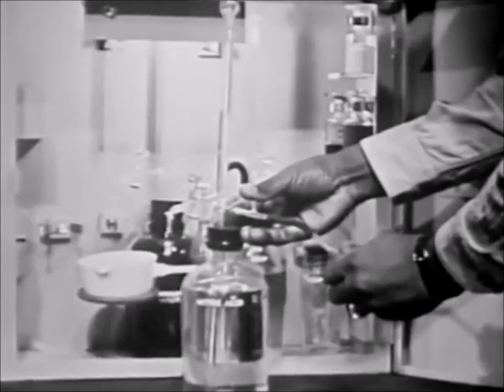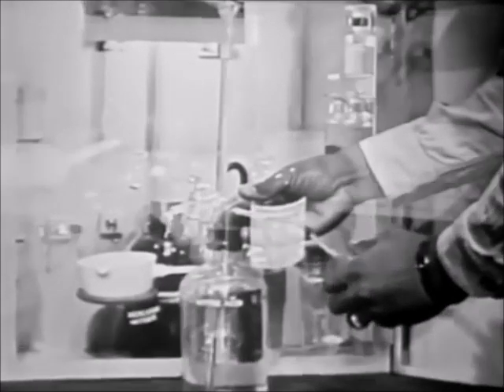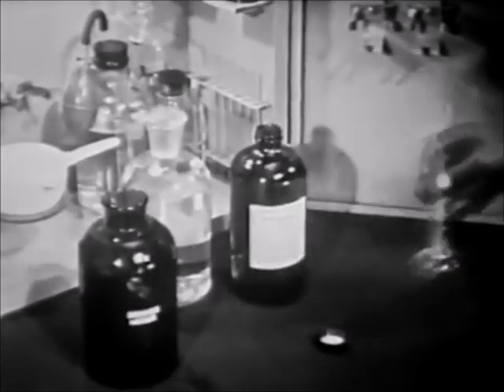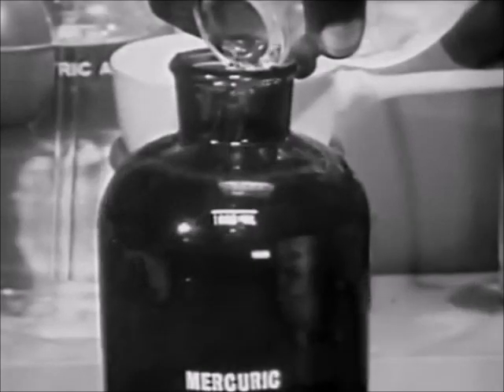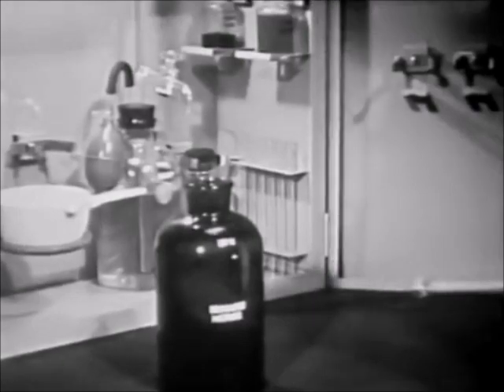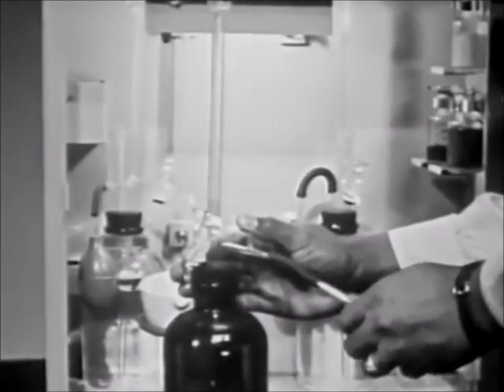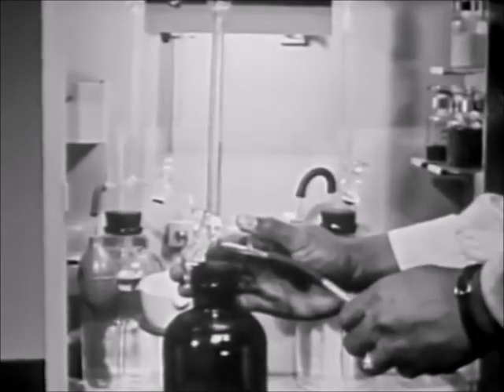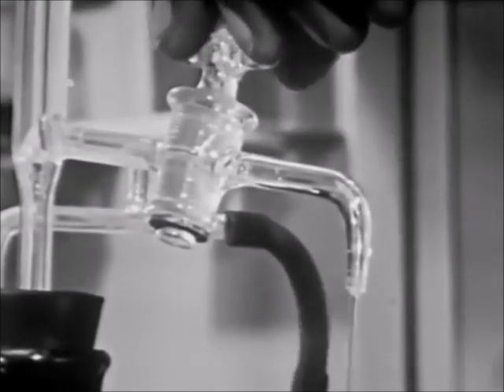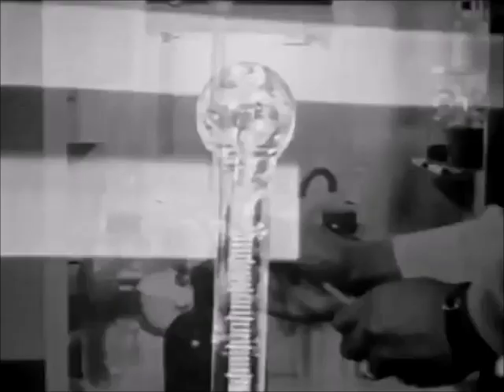Follow the same procedure to prepare the mercuric nitrate reagent. Transfer 50 milliliters of stock mercuric nitrate to the reagent bottle. Add distilled water to the mark and mix the contents. Place the burette assembly on the reagent bottle and pump up the burette. Drain a little solution to be sure the burette tip is full, then pump the burette back to zero.